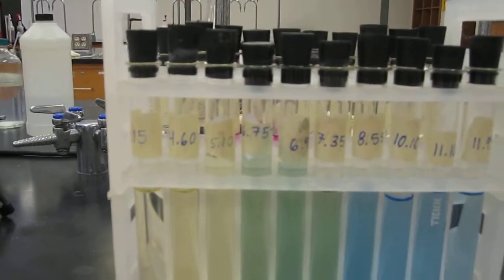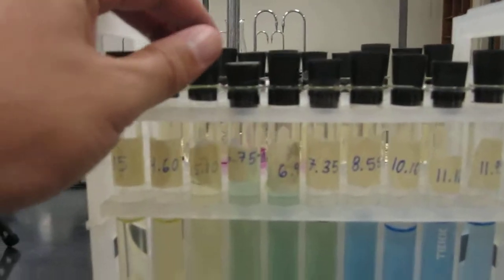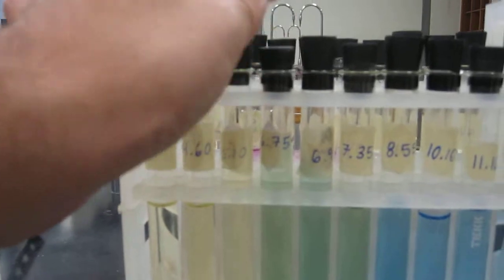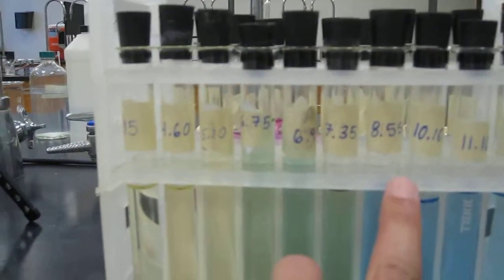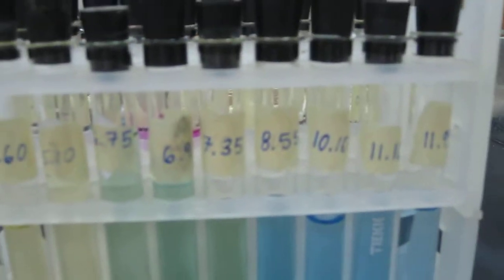But you'll notice the range that you're going to be using this is from 6 to 8. So that's about where the yellow turns to green and then back to blue, if you can look at those numbers there.